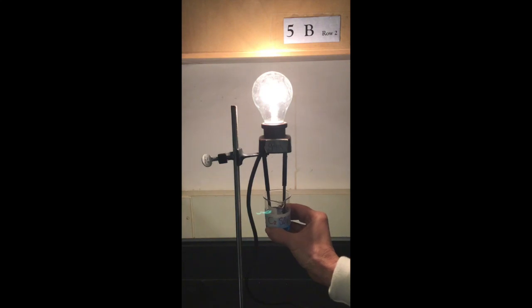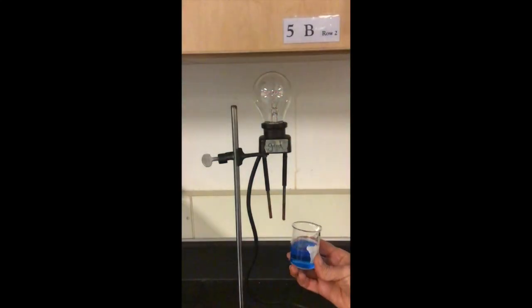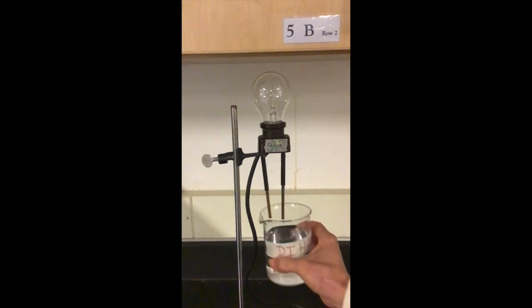Copper sulfate. The solution in this one is this blue color. That's due to the copper ions that give it that lovely blue color.